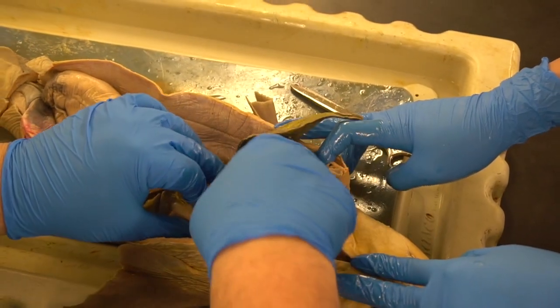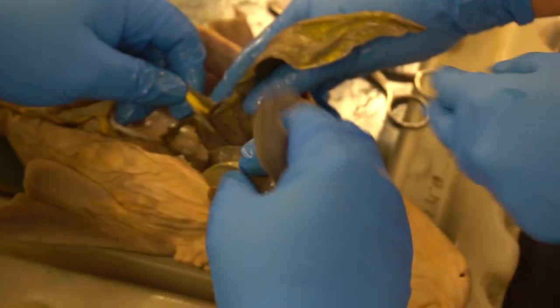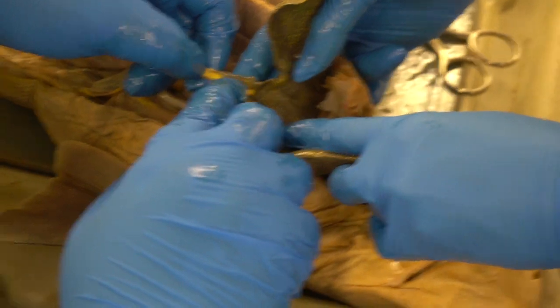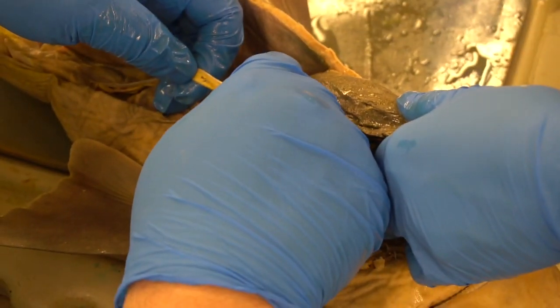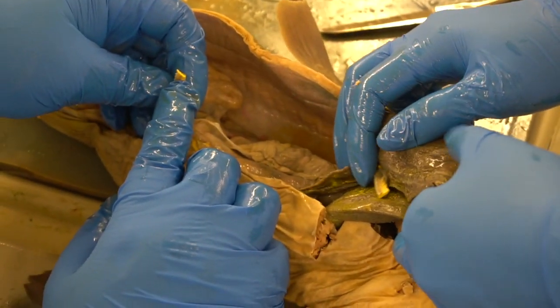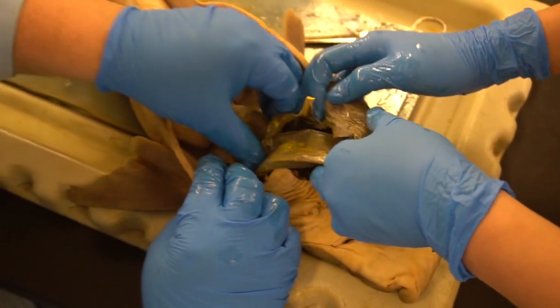If we reflect the liver, I might have to. Here, why don't we do this, Ange? Take. All right, and everyone got a chance to see the duct there, right? So let's just snip the bile duct right in the middle. Okay, and this is dyed yellow, so you can see this is part of what we call the hepatic portal system, which we'll explain at a later date. Okay, we just want to get a view of the organs here.